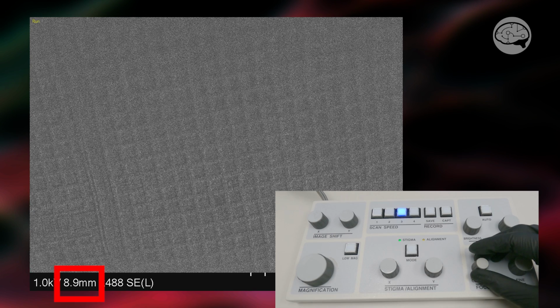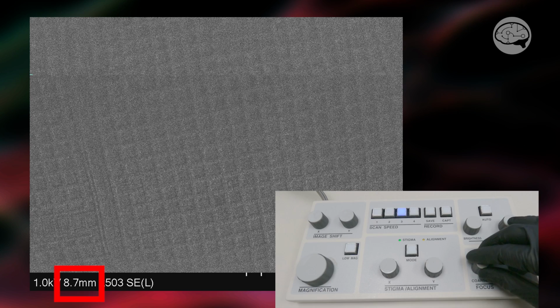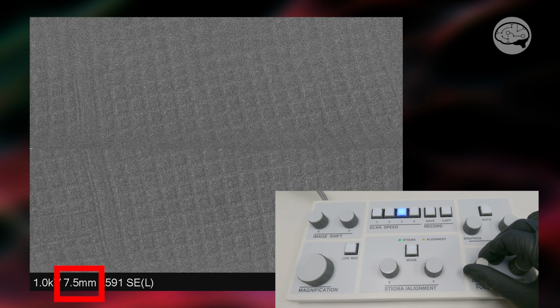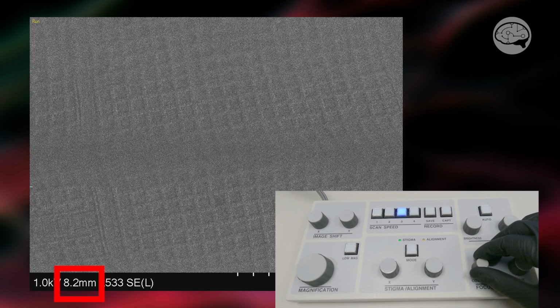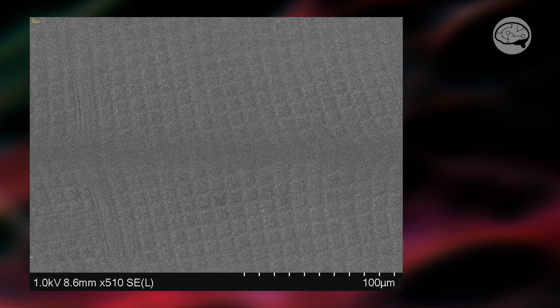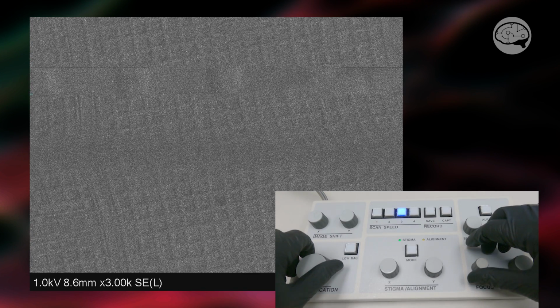But I'm going to keep turning the knob, and I can see that it's gone out of focus. I can move it back a little bit. Basically just move it back and forth to get a feel for right where it's in focus. Which looks to be right about there. And you can see that that was very quick. This was very simple, very easy to do. And we'll do it again at a higher magnification and see what we can get out of it.